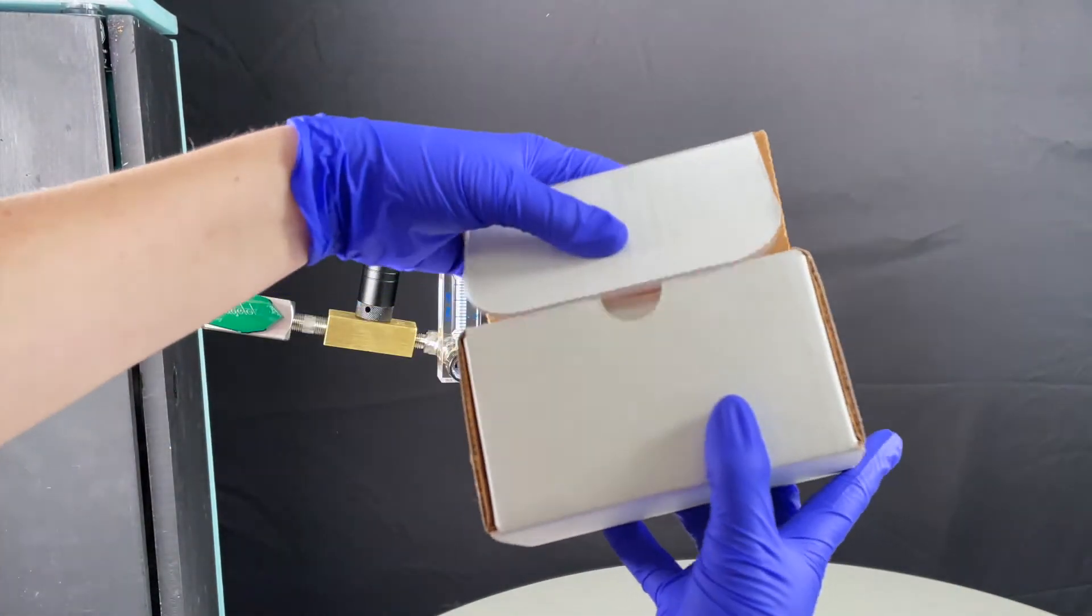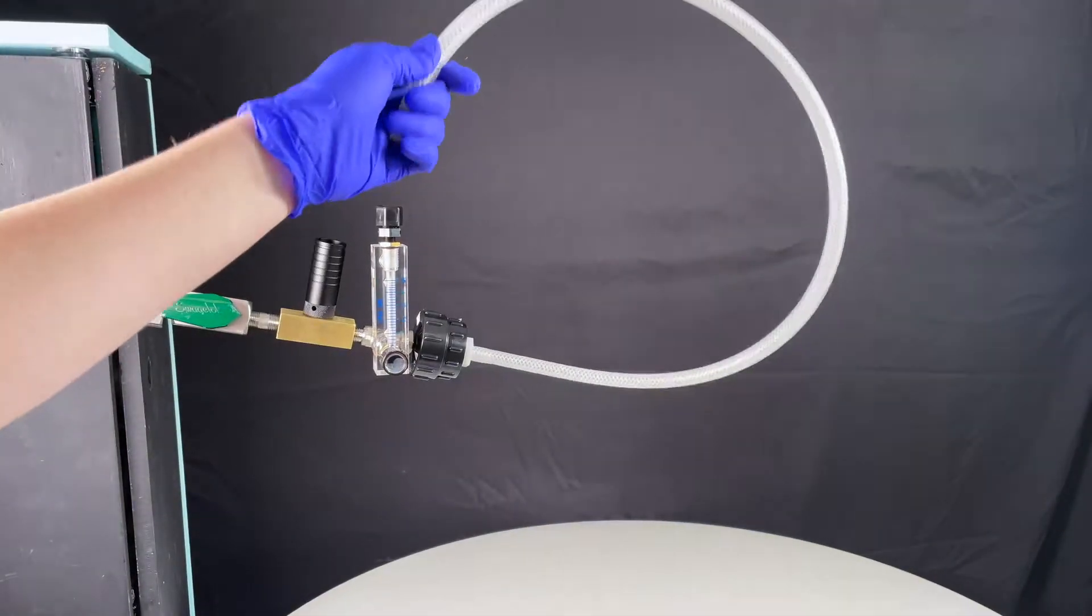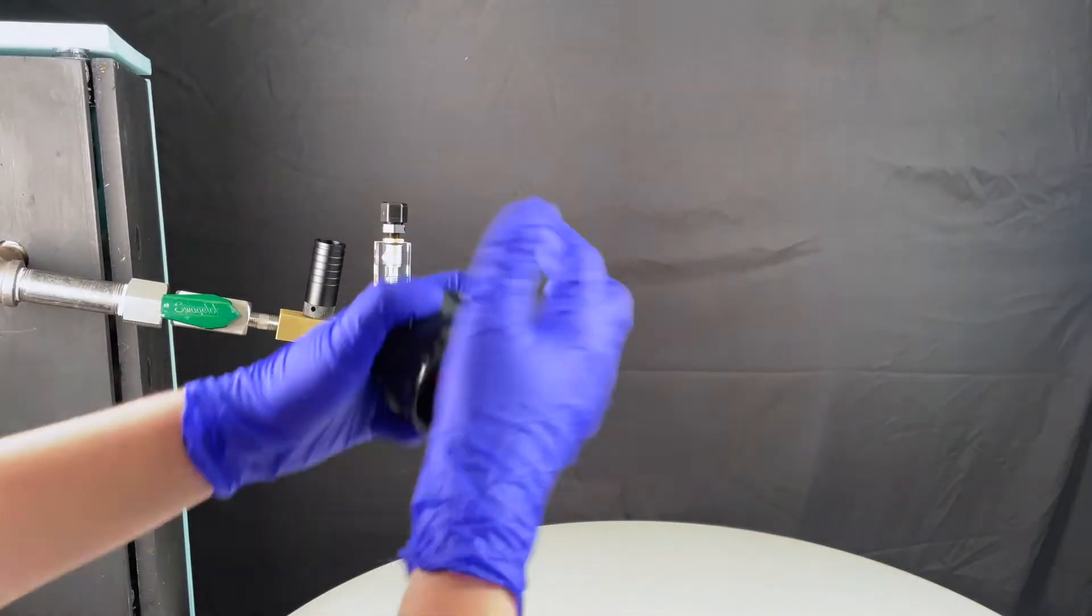This must be returned to Trace in order to receive results. Disassemble your AirCheck kit and return the provided parts to the box.